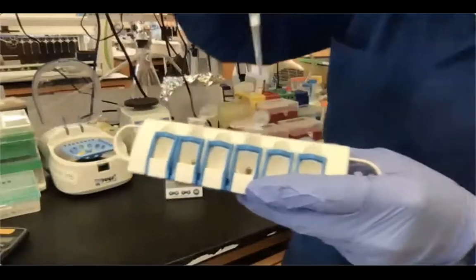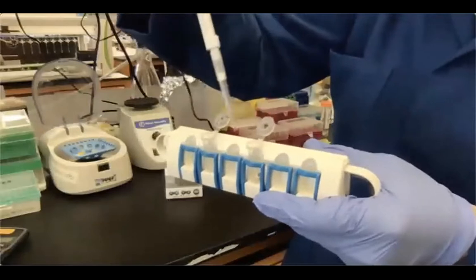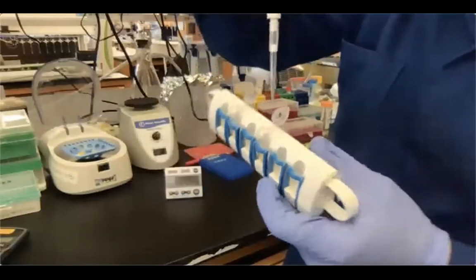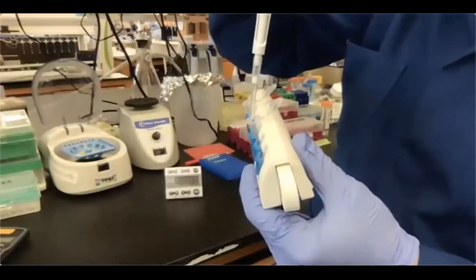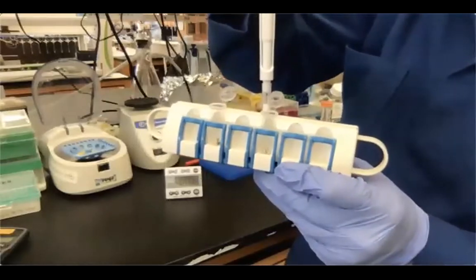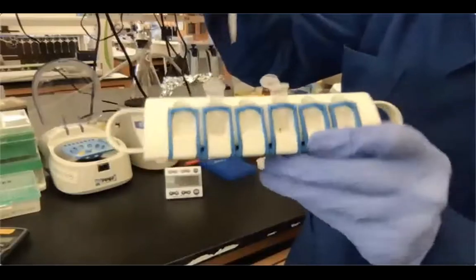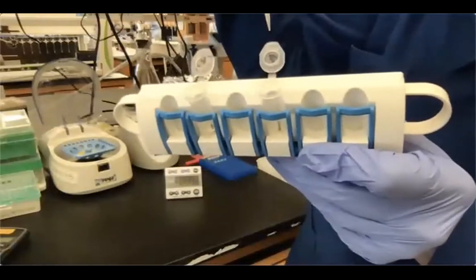Okay, let's try to do a close-up. I'm setting my pipette to 133 microliters, so I'm hopefully leaving 7 microliters in without touching the bead pellet. I'm facing my tip in the opposite direction from the magnet, going in and removing my supernatant slowly, okay? So let's check that the bead pellet is still there.